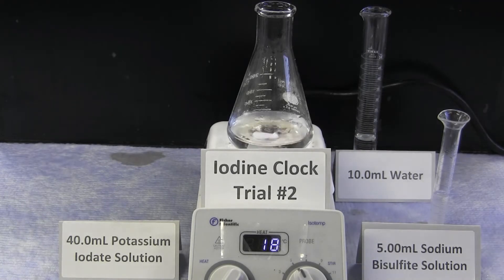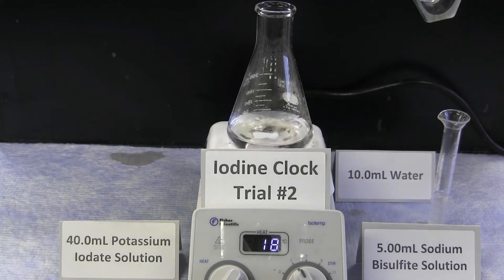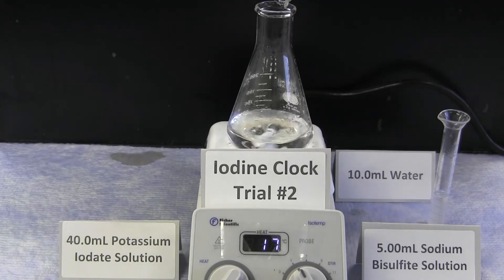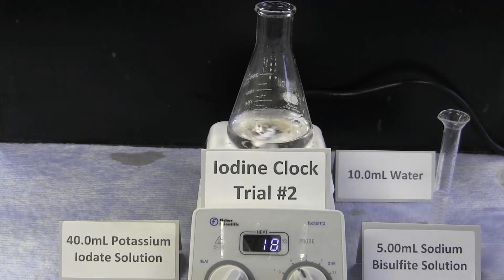40 milliliters of potassium iodate solution is combined with 10 milliliters of water, thereby lowering the concentration.